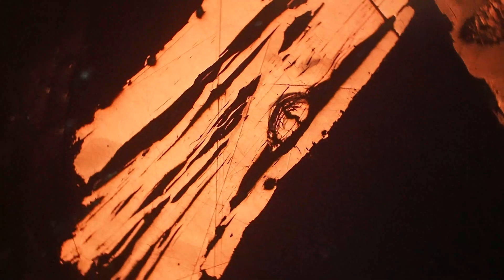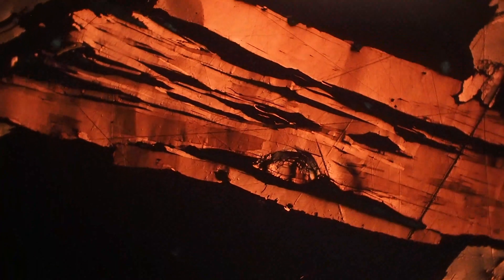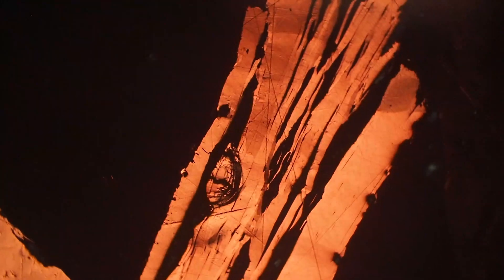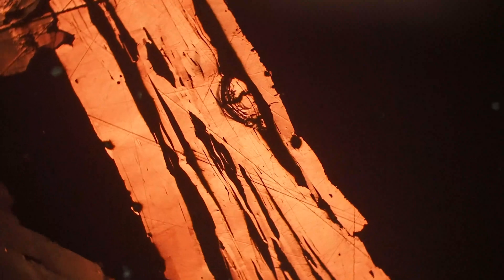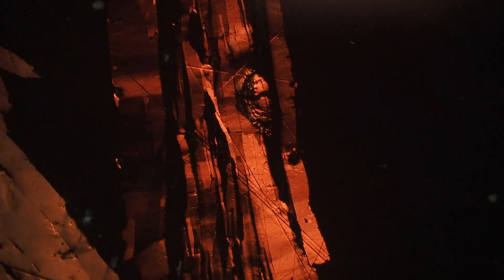Another thing that can help identify this mineral is that it's quite soft. You can see some scratches in there, especially the fine ones — even with very fine grit polishing you might get little scratches in the crystals. Also, if it's polished alongside other harder minerals, those harder minerals will stand above the covellite a little bit, looking like little islands amongst the softer covellite.